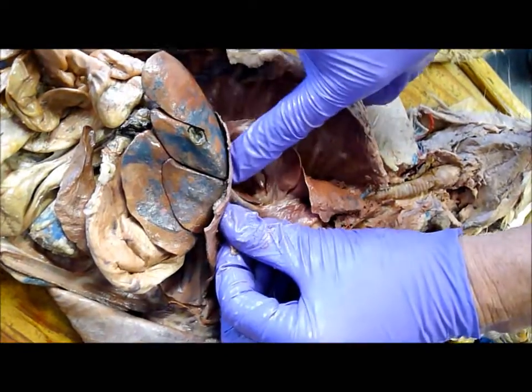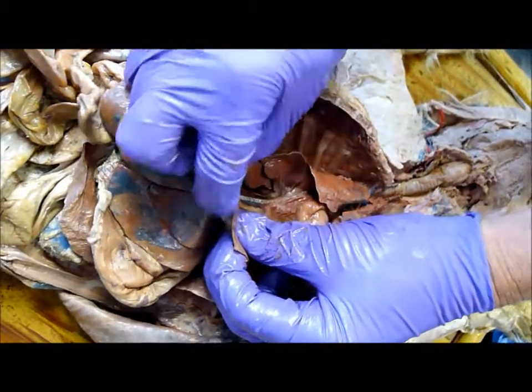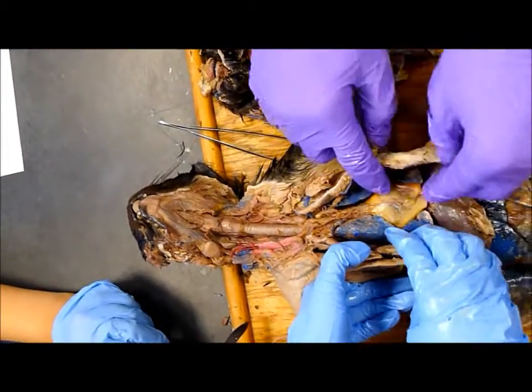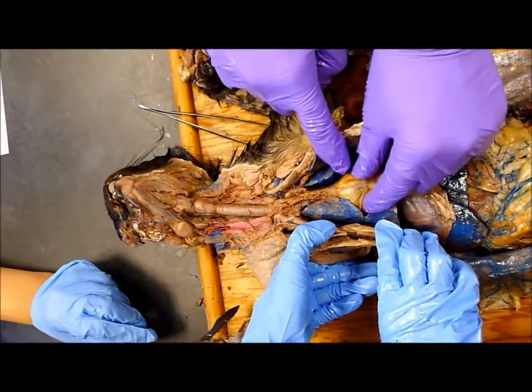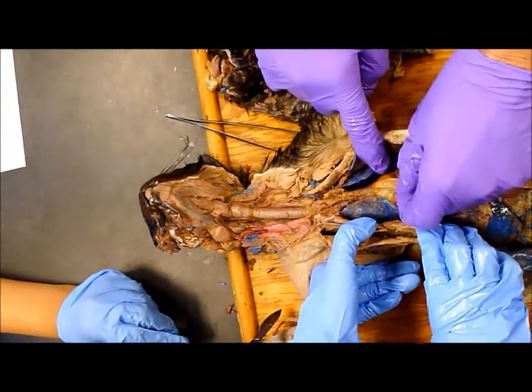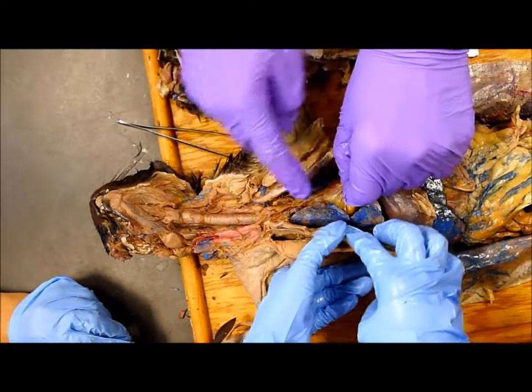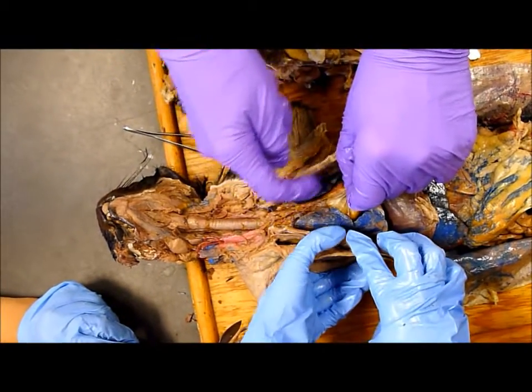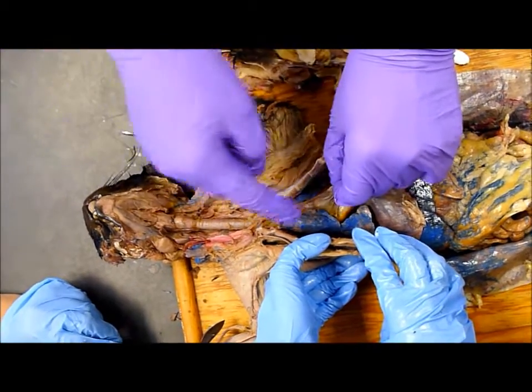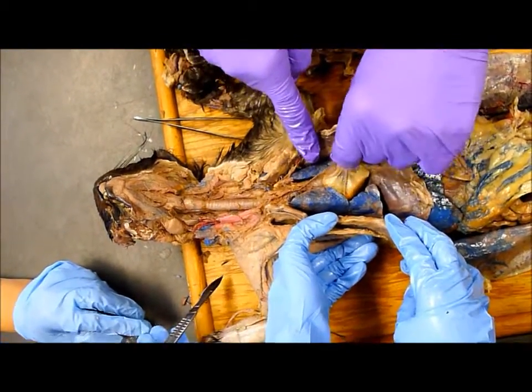See that white dental-floss-like structure on top of the inferior vena cava? That's the phrenic nerve that goes to the diaphragm. And so this is the mediastinal septum — the septum that surrounds the heart and pericardial cavity. It was attached right there to the sternum, so it goes from backbone to sternum, and it separates the two pleural cavities from each other.